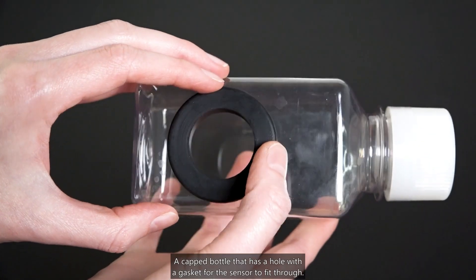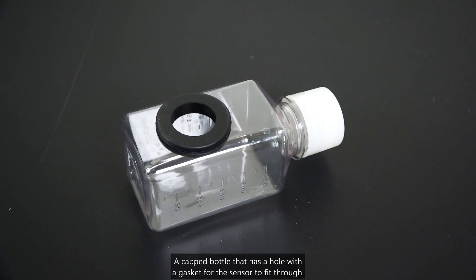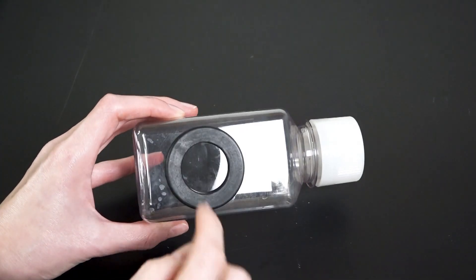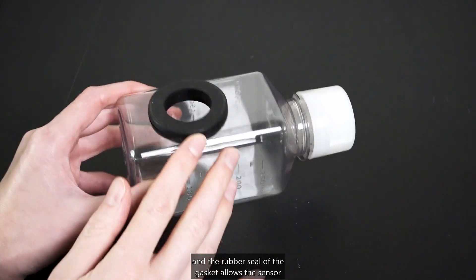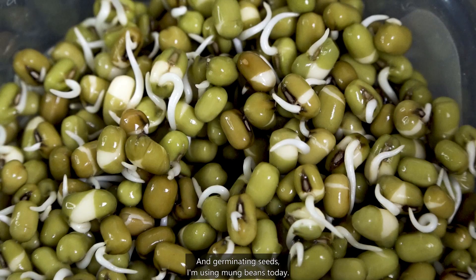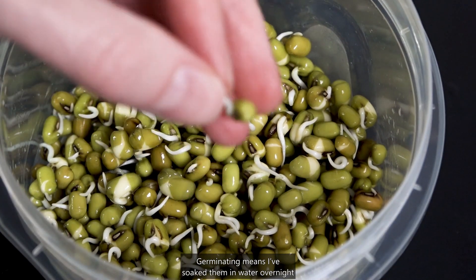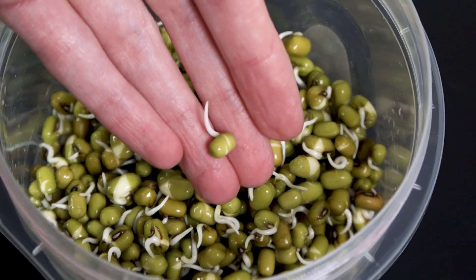You'll also need a capped bottle that has a hole with a gasket for the sensor to fit through. These special bottles often come with the sensors when you purchase them, and the rubber seal of the gasket allows the sensor and bottle to be joined without leakage. And germinating seeds — I'm using mung beans today. Germinating means I've soaked them in water overnight and they've just started to sprout.